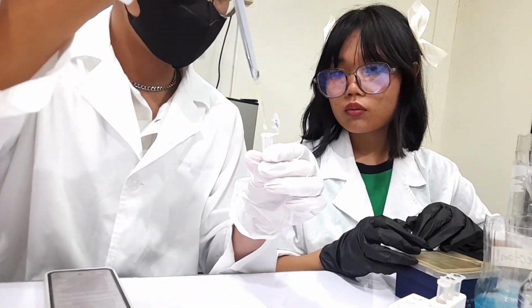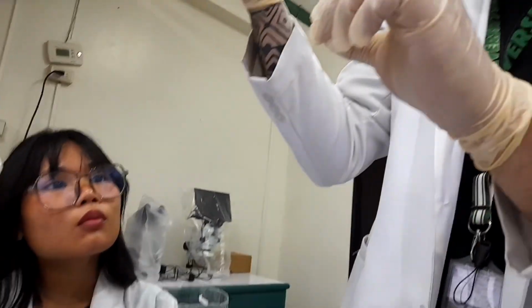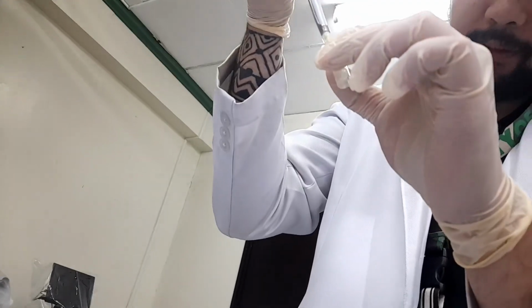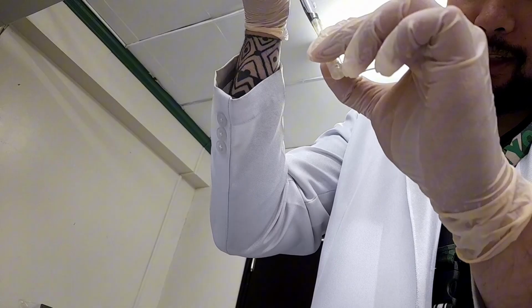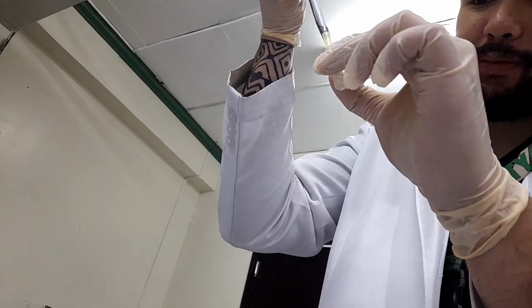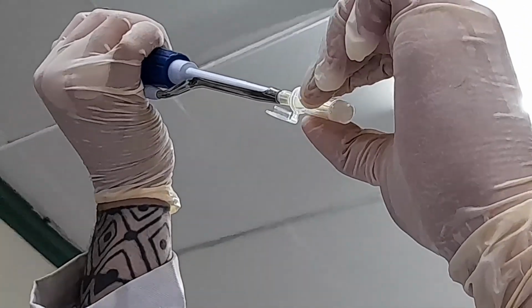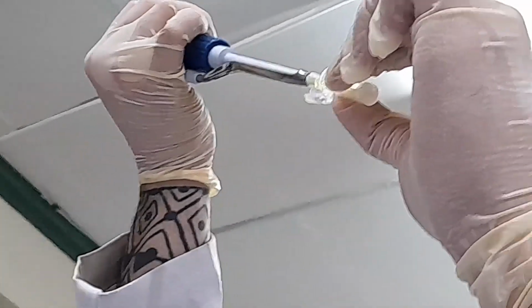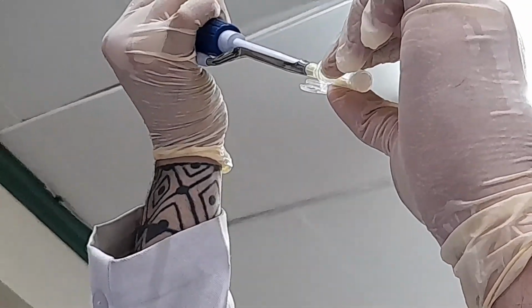Oh, okay. So when you do this, right? You pipetted it in, right? Is it in here? Yeah. So when you resuspend, you see what I'm doing, and then pipette out. Actually, I should have been more gentle than that because I don't want there to be any bubbles. But this is okay for now. I know I said not to touch it, but sometimes they can be very stubborn. So we'll just do this. There we go. Usually they'll be really stubborn when it's really dense. Yeah, try this.